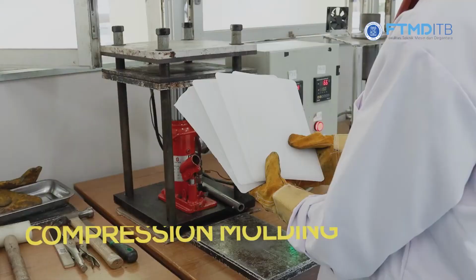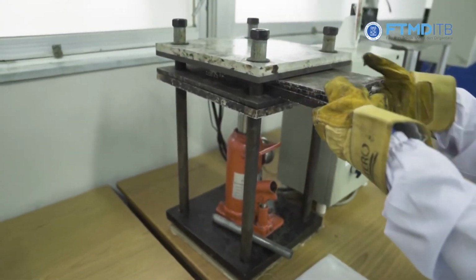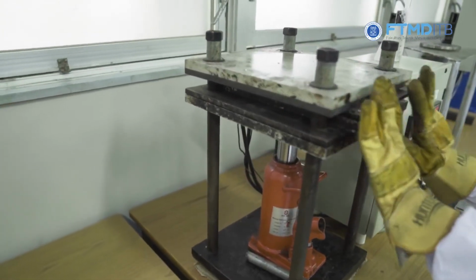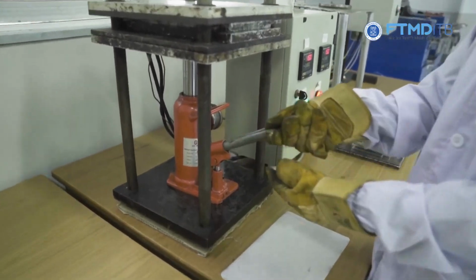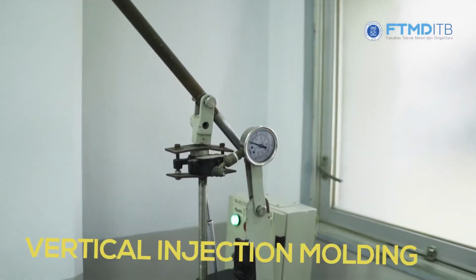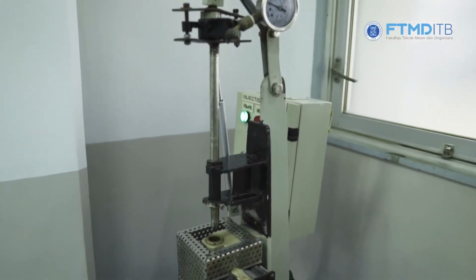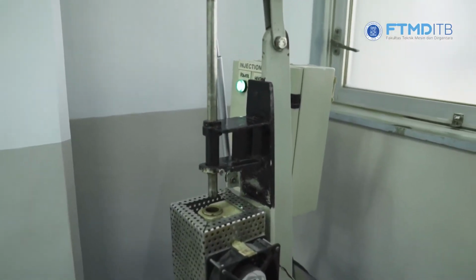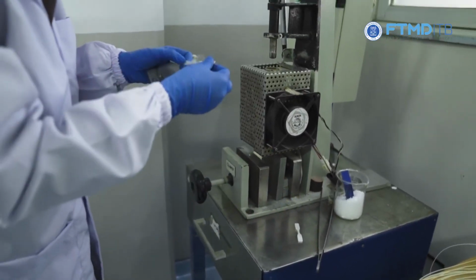This is one of our plastic processing machines called compression molding to create material like this plate. We use a mold here filled with thermoplastic, then press using this hydraulic press and let the polymer melt. Next, we have a vertical injection molding machine that we use to manufacture materials like these tensile bar specimens. We can vary the time, temperature, and pressure during the molding process.